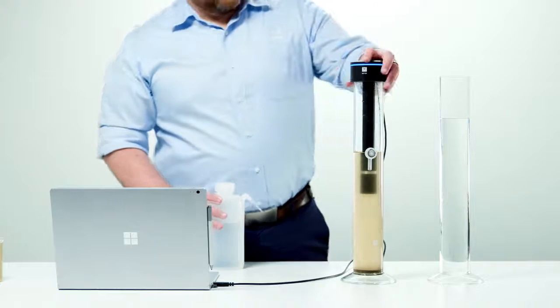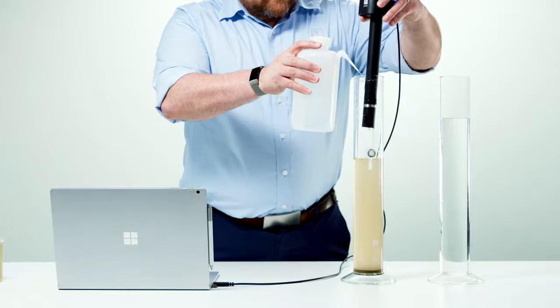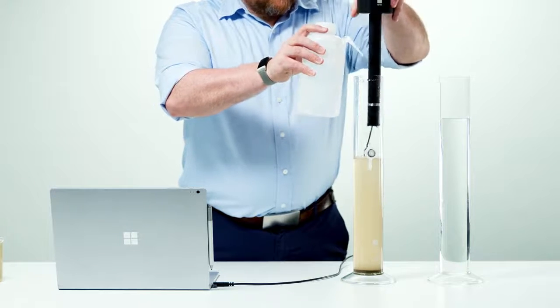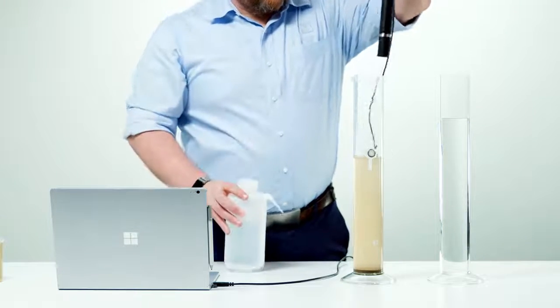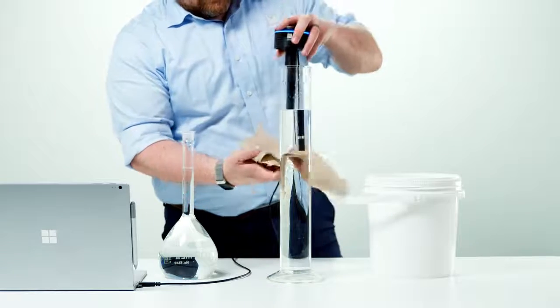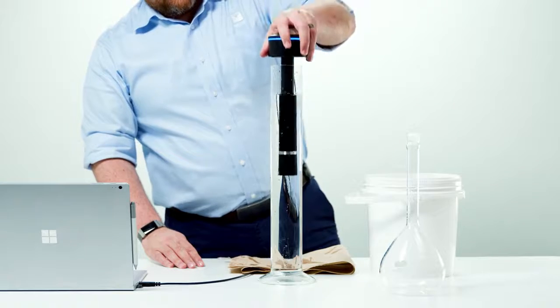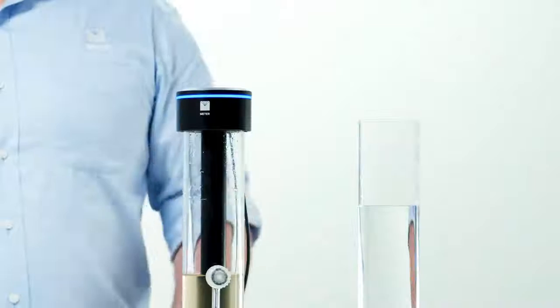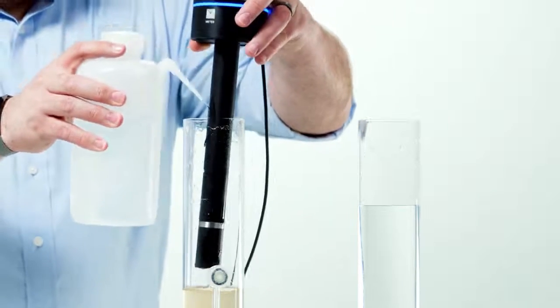After completion of the measurement, lift the PARIO device out of the suspension in the sedimentation cylinder and place it back in the standby cylinder with distilled water. If necessary, rinse the shaft of the PARIO with a gentle jet of water and clean the shaft with a soft cloth before inserting it into the standby cylinder with distilled water. Never touch the pressure sensor that is shielded by the sensor cover at the end of the device shaft. Spray only a soft stream of water in the area of the sensor covering to avoid damaging the pressure sensor.